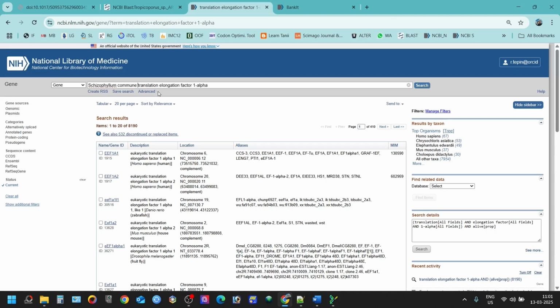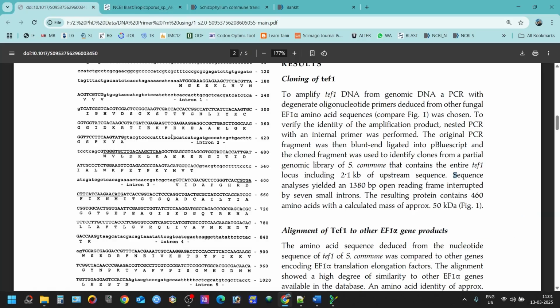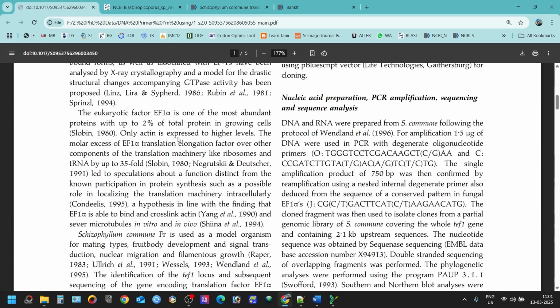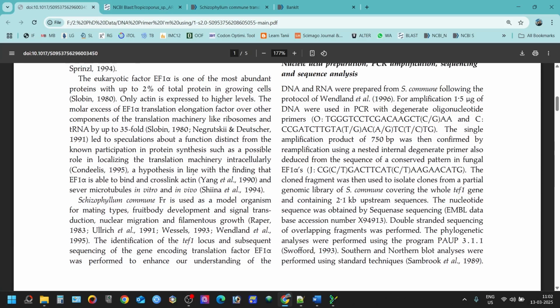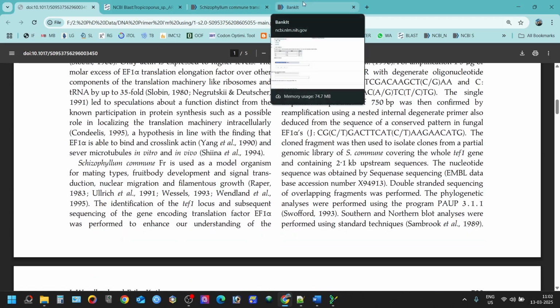So I put this species, which is one of the model organisms, because the sequence that I have amplified, the primer was generated based on this species, Schizophyllum commune. You can see from here, this is the paper that they have worked on, and they have prepared the primer that I've used to amplify the sequence that I'm submitting.